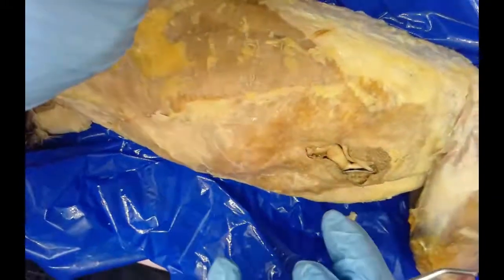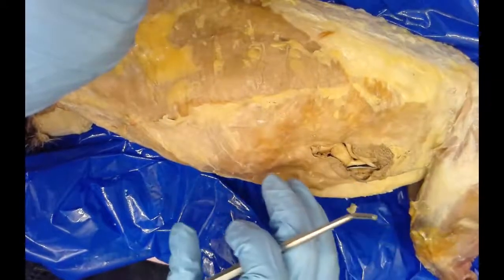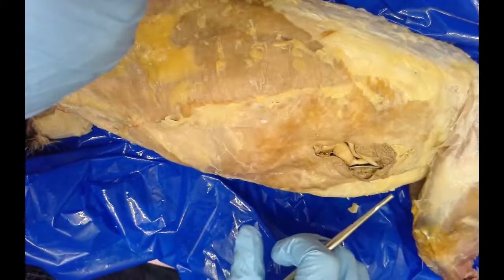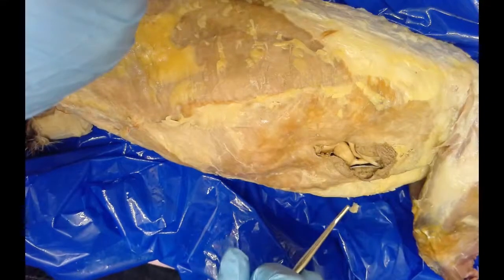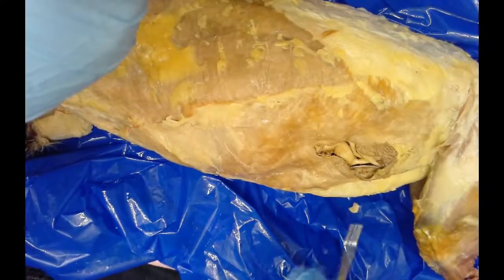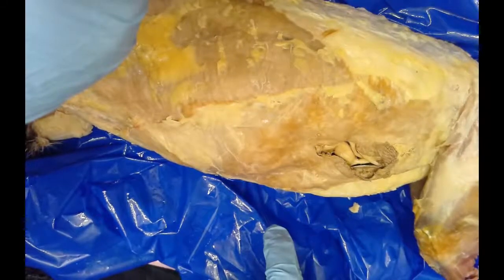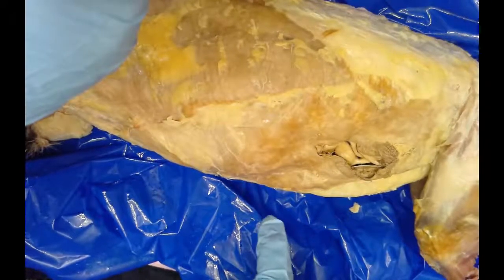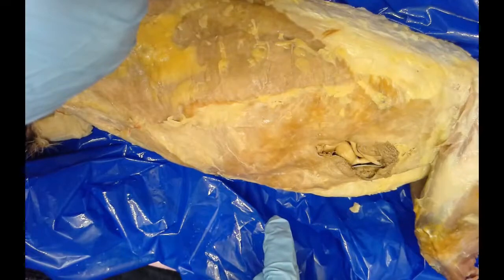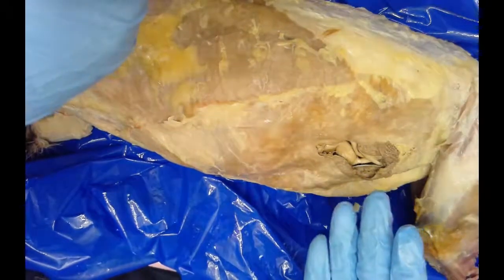If the skin were still intact on this female, we would notice that she had nipples — about four or five pairs. And actually males have them as well. But in females, these are openings that connect to the mammary glands located just underneath the skin. Since the skin is absent, obviously we're not going to see those.